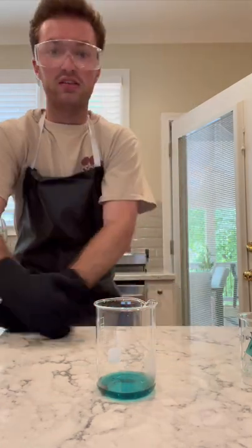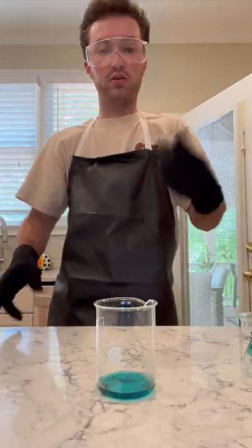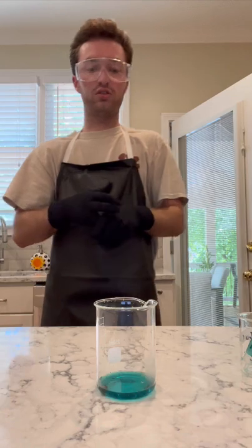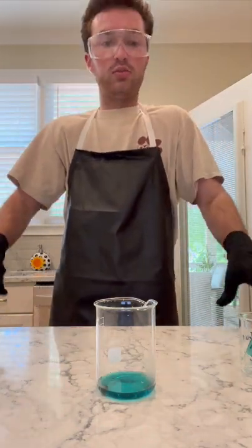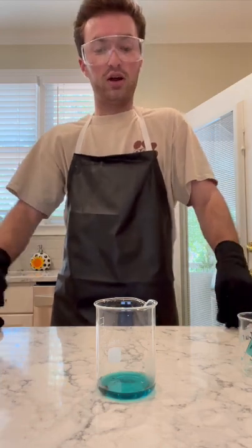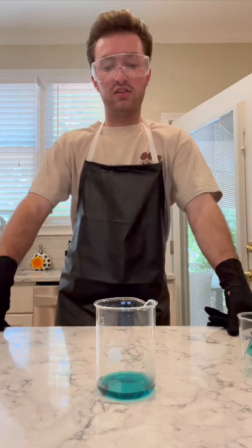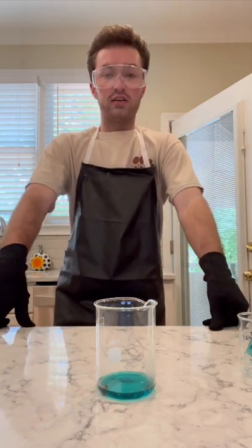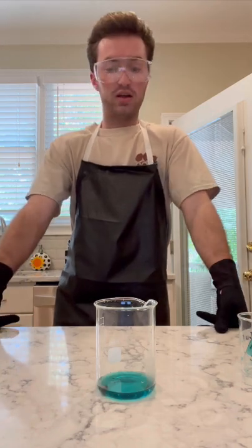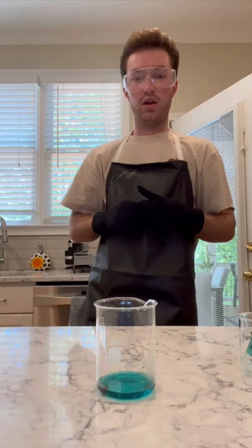With that change, the energy is being released, so that's obviously an exothermic reaction. Just based off the chemical formula, this is easily a single replacement reaction. But based off looking at the reaction, I would say this is probably an oxidation or redox reaction as well. So yeah, obviously a new substance was formed, and that's my reaction.